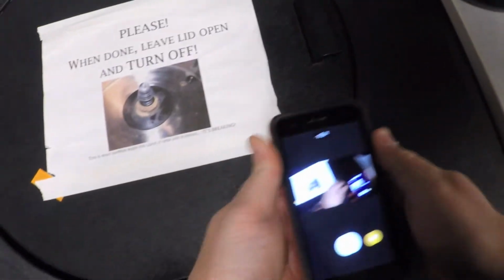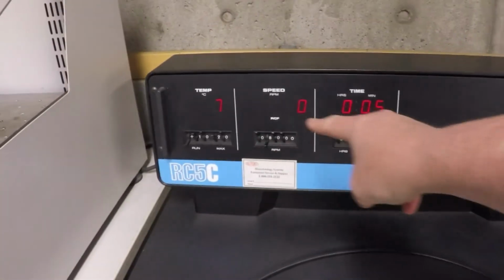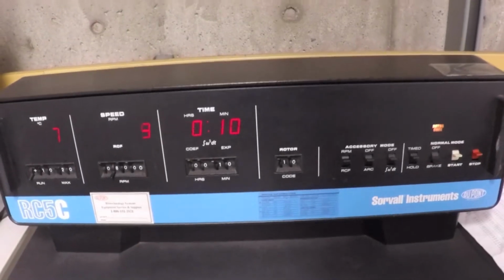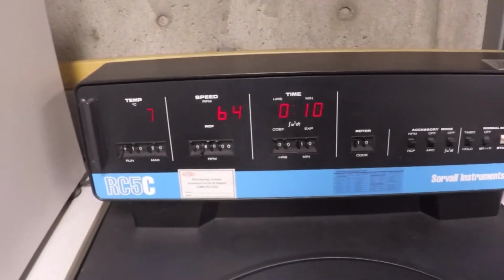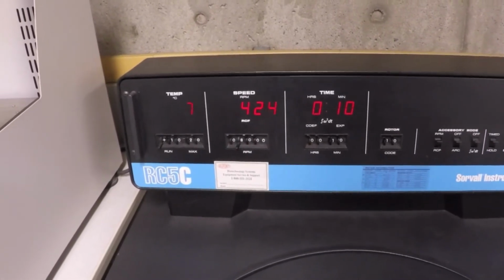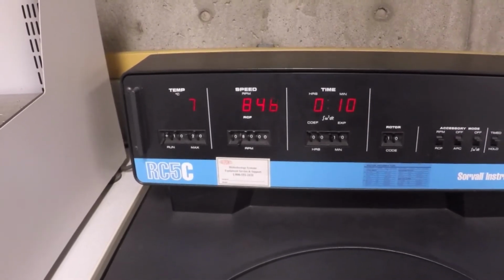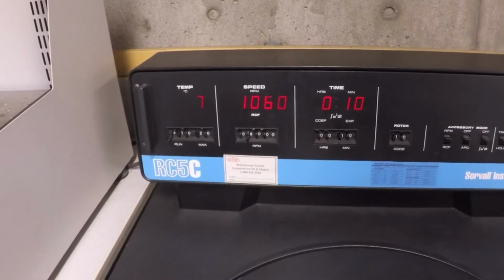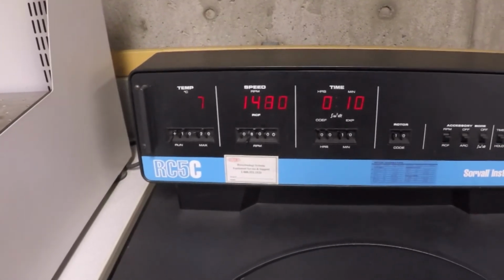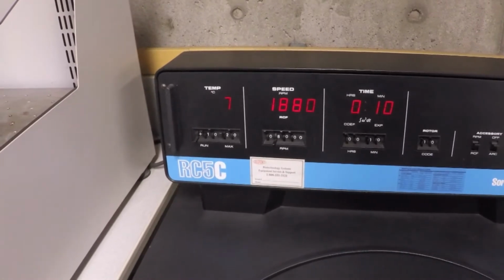Thank you for pressing the self-destruct button. This ship will self-destruct in 3 minutes. We're good. Take one last scan like a pilot. Make sure all your instruments are right. Hit start. And then hang out. Again, waiting for this thing to get to 8,000. Just to be sure. And then this baby will run for 10 minutes. And then what we're left with is a pellet that we think is a pellet of bacteria. And we'll go down to my other lab down there, and we will show you how to resuspend that in 5 mils of buffer.